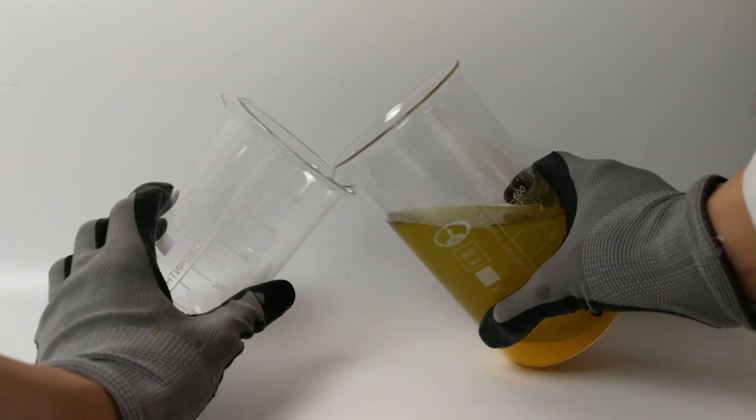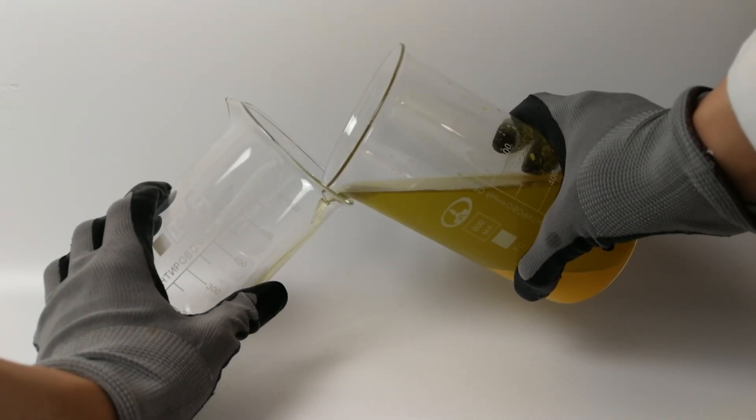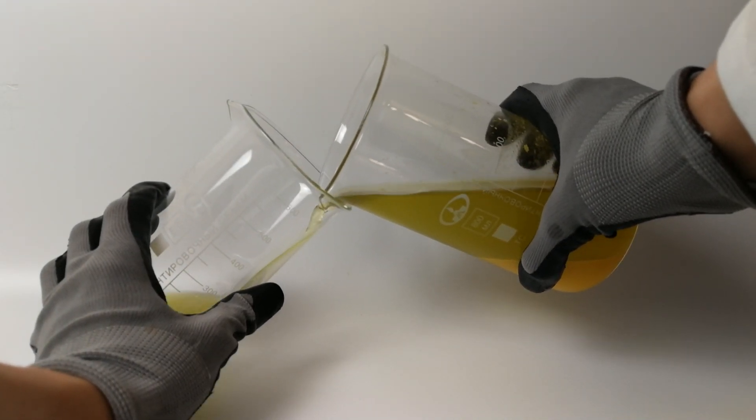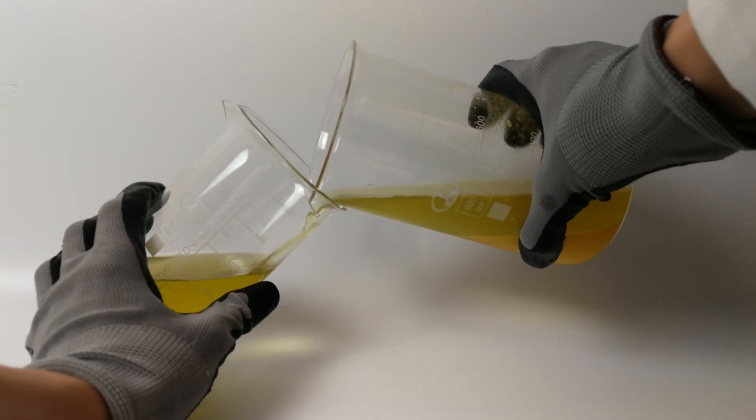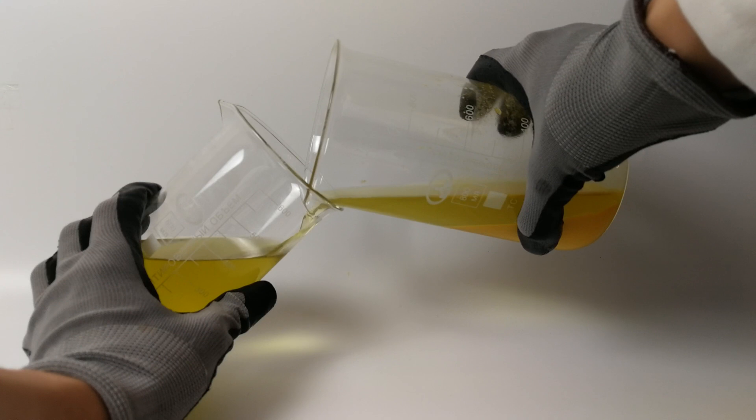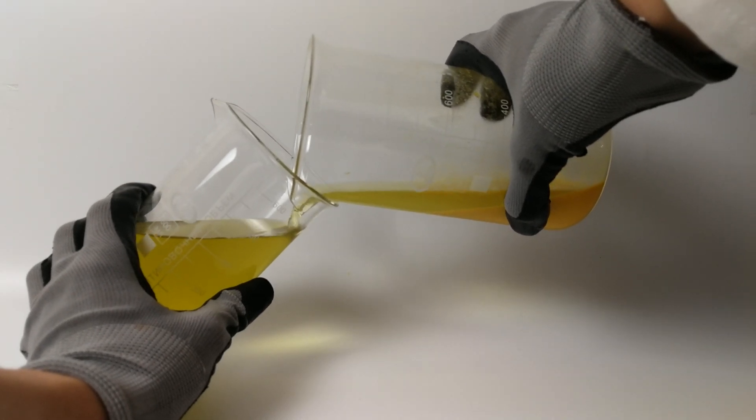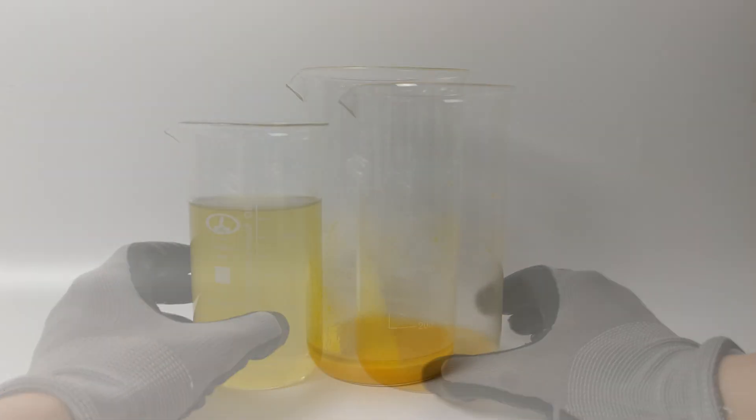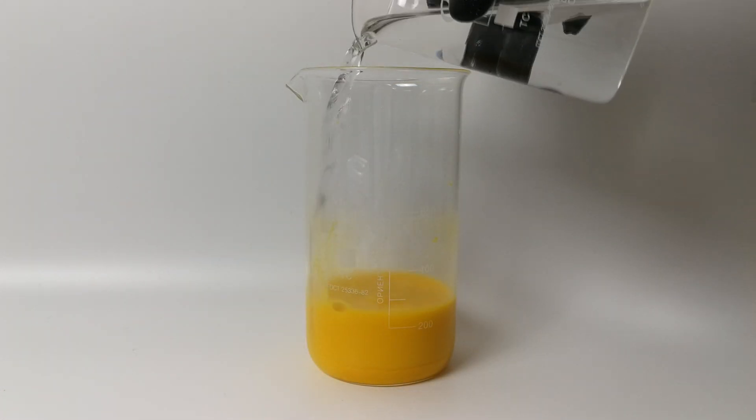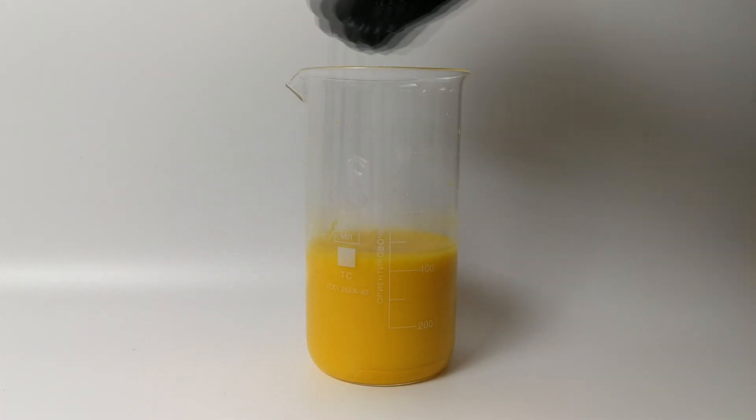Now, we can decant the solution to another beaker. Since I'm not going to extract anything from it, it can be discarded. Before filtering, it is best to wash the precipitate with water a few times.